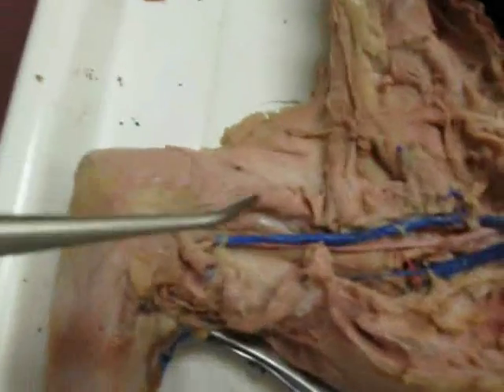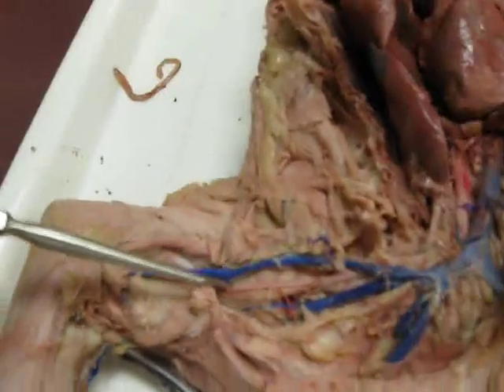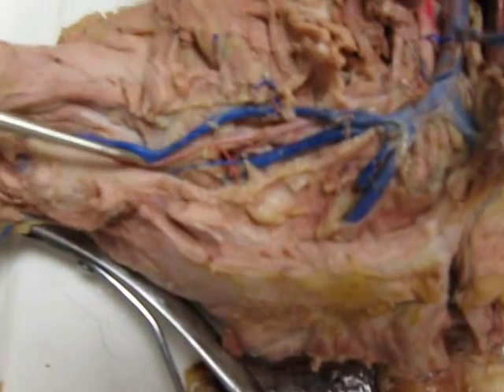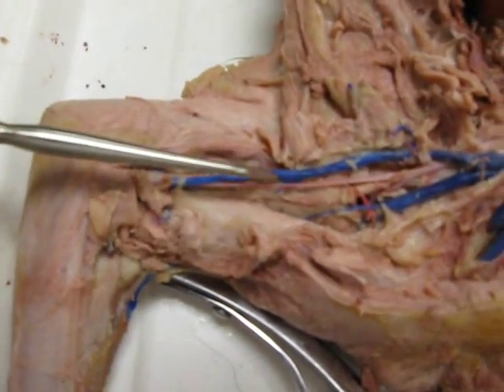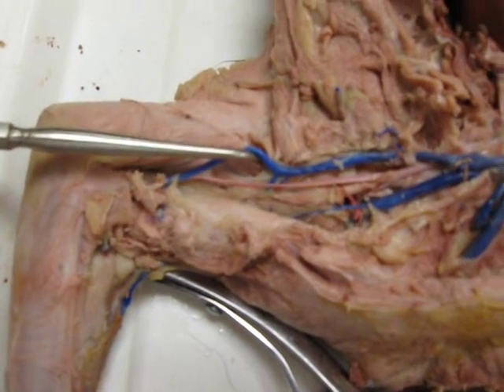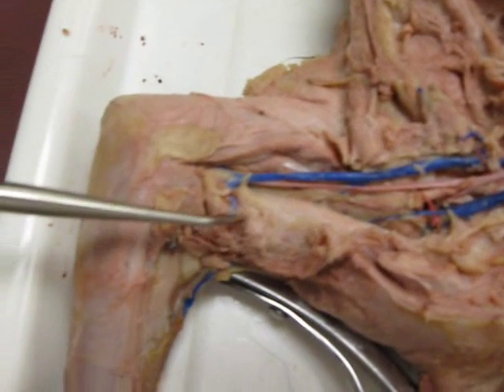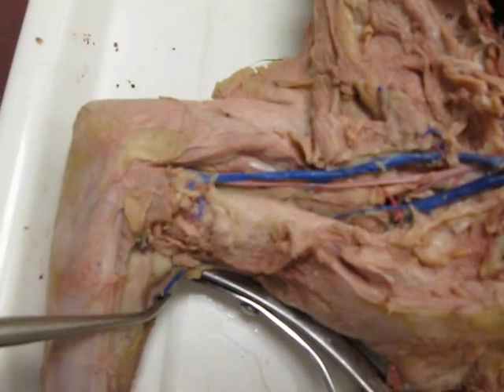And then your axillary vein is going to have a branch called the brachial, and that's, sorry, I'm trying to do this with one hand. That's right here. Okay, so that branch there was your brachial. And then the rest of this is going to be basilic to the median cubital, which connects to the cephalic that came out behind the back of the arm.